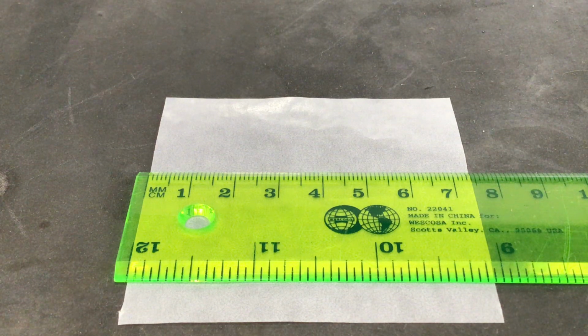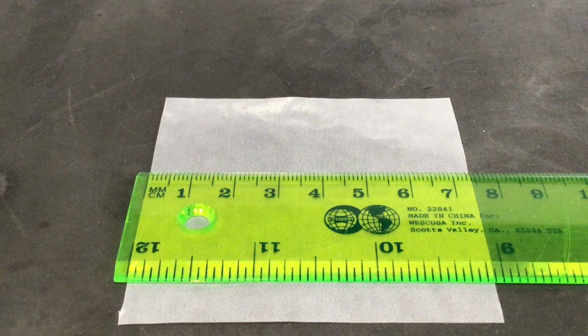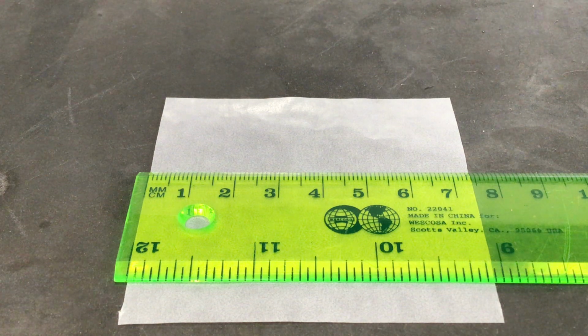Similarly, if I was measuring this in millimeters, the individual tick marks that are there would now be more like 74. I could say 74.0, or again like 73.8 or 74.2 or 74.1, whatever you think, wherever you think that tick mark is.